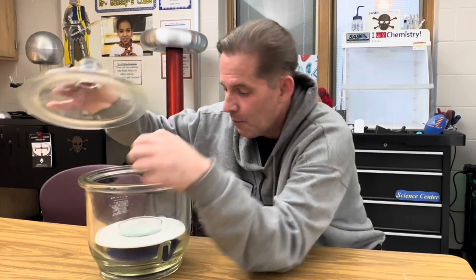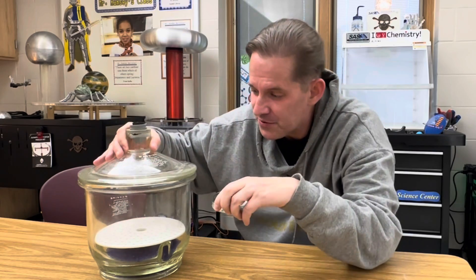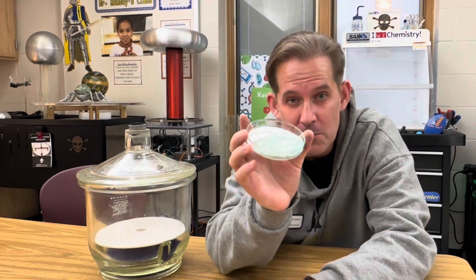It's been a couple of days. Let's check out our bismuth 3 nitrate — it's been in the desiccator and I think it's all dried out. I wanted to show this to you because bismuth 3 nitrate is used in the pharmaceutical industry.